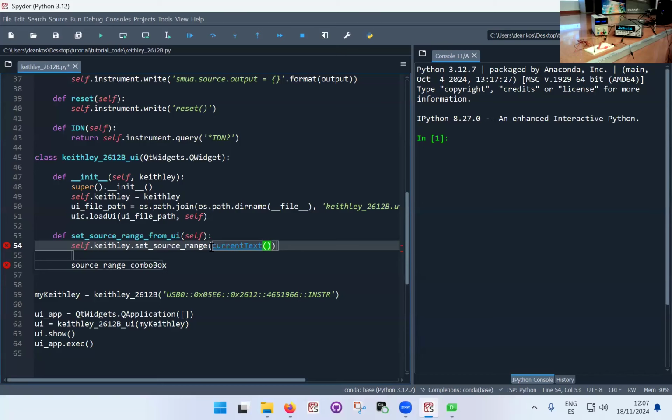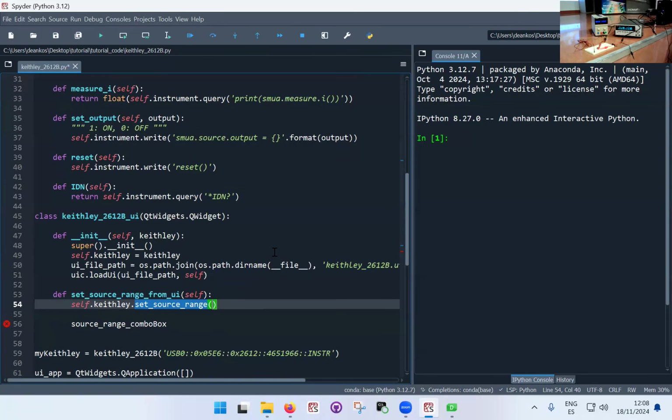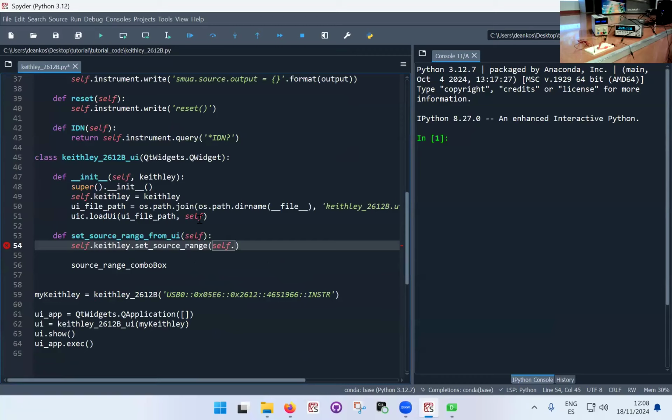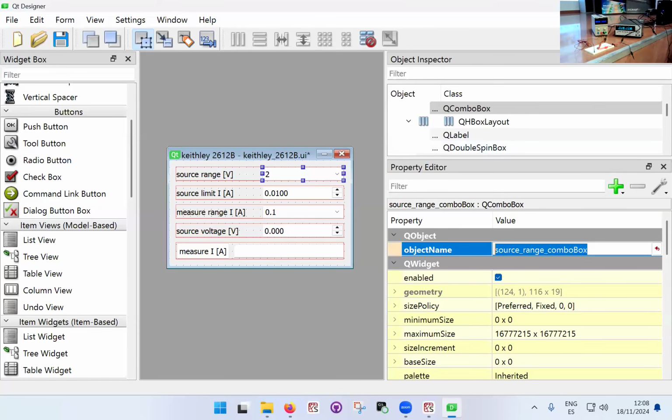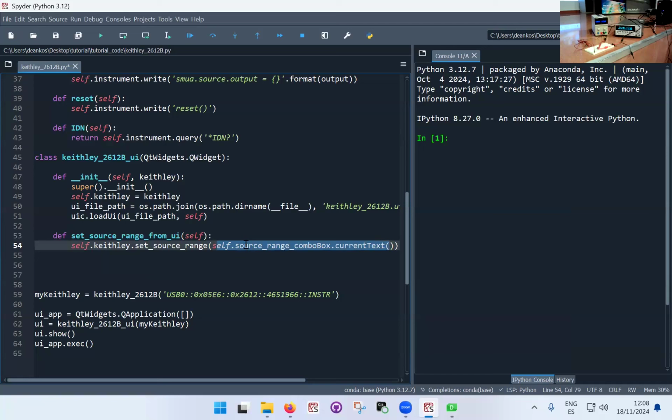Yeah, that worked. So set source range, and now this is the Keithley command that we implemented earlier. Set source range. I need to pass a value, okay? What value am I going to pass? I'm going to pass self dot the name of the box, source range combo box. So that's this, pretty much. So I'm going to move that there. Dot current text, okay? In principle, this command takes the combo box and returns the current text that is in the combo box, okay? And then this text is passed to the set source range function of the Keithley to set the value in the instrument, okay?